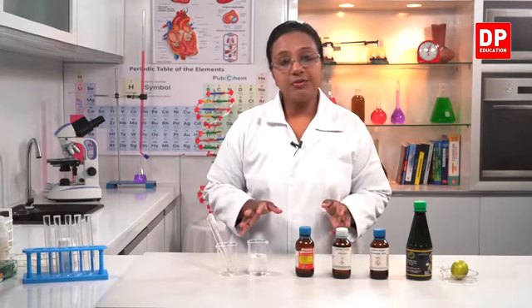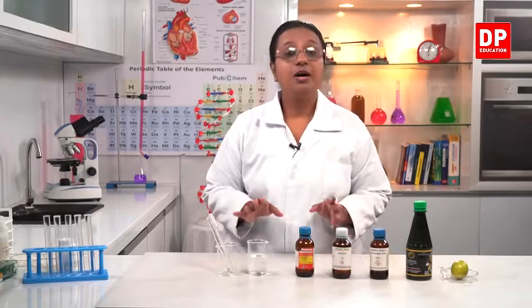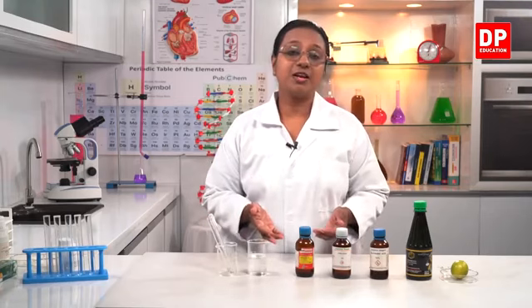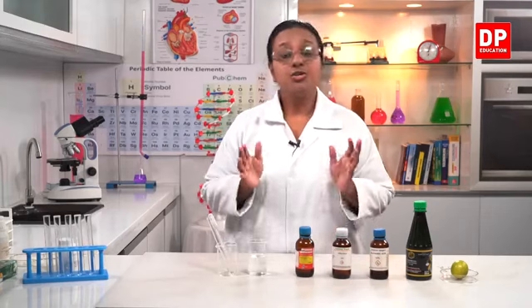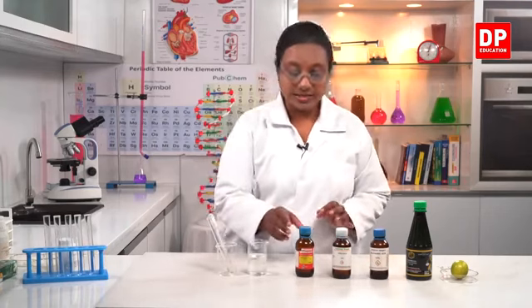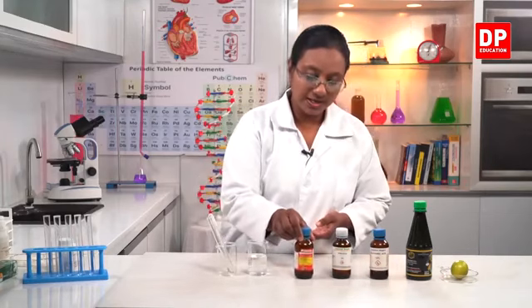So how do we dilute acids? Do we add water into acid? No. What is the reason? The reason is there will be a lot of heat generated. Due to that, there can be an explosion. It's dangerous. So to avoid that, what we do is if we want to dilute an acid, now let's say I want to dilute the hydrochloric acid here.